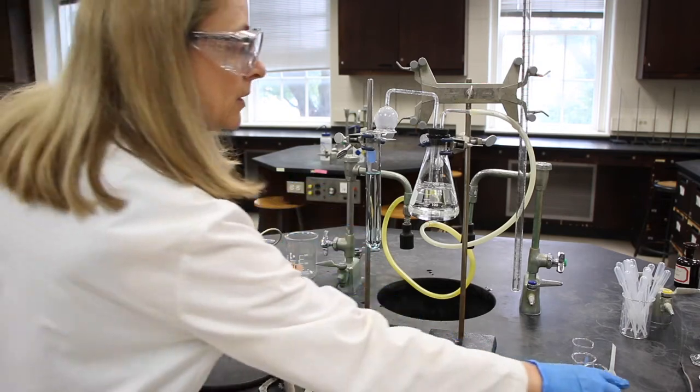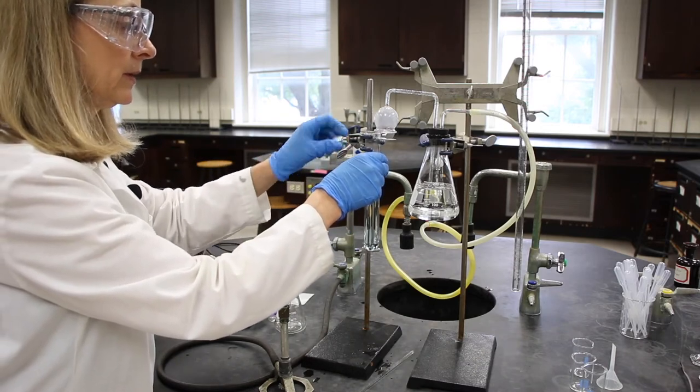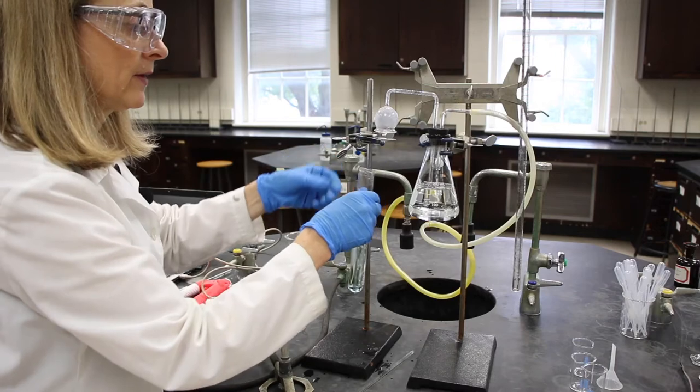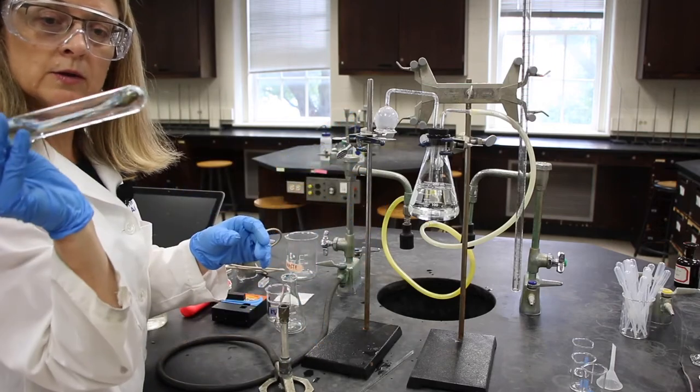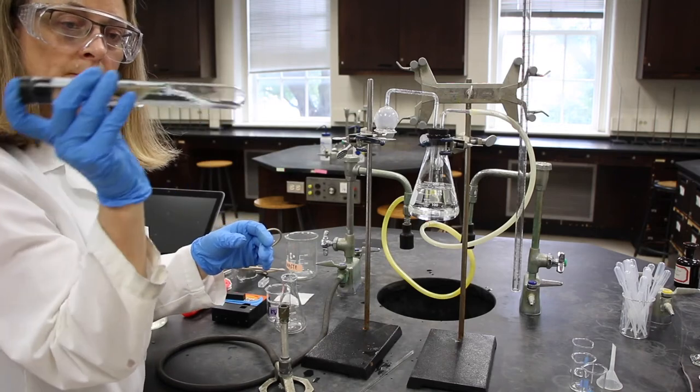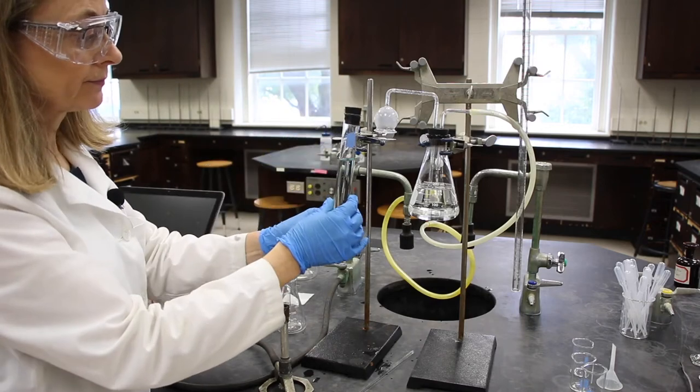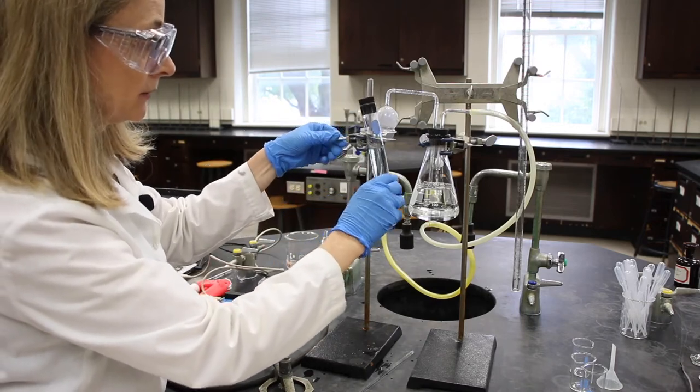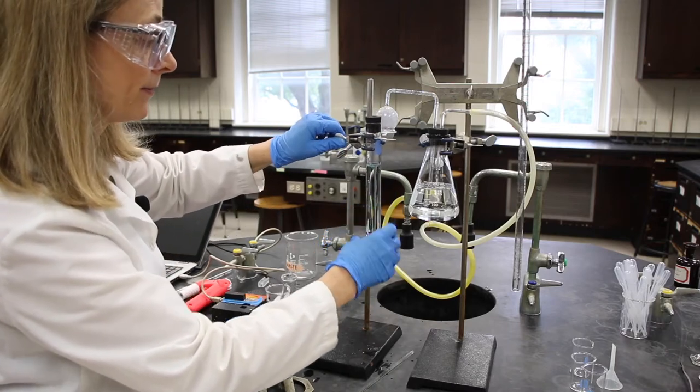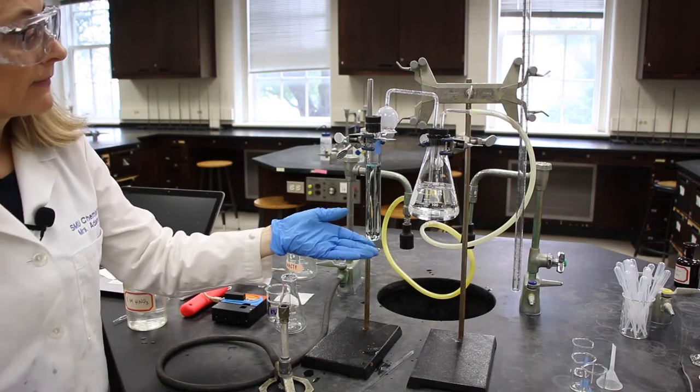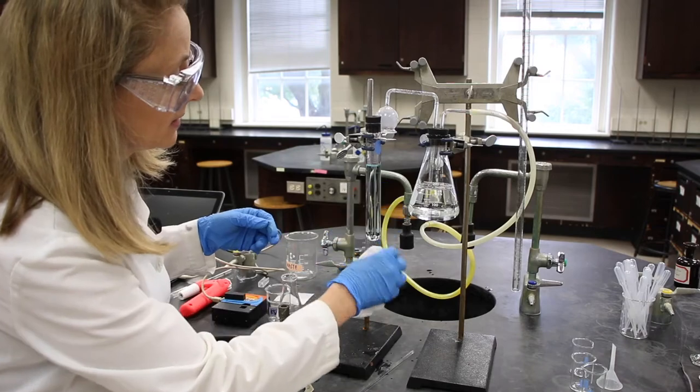We can now use our stopper. We'll remove the test tube from the clamp and just mix it. Now, the solution will be colored, and it should be clear. If it is at all cloudy, let your instructor know. And now we can continue on with the rest of the experiment.